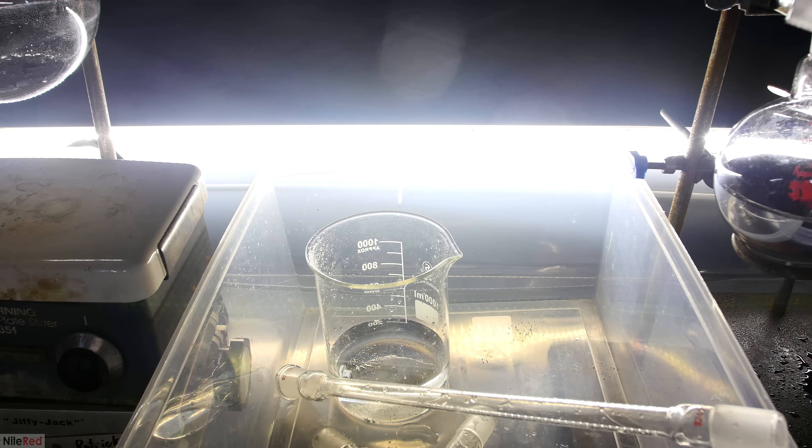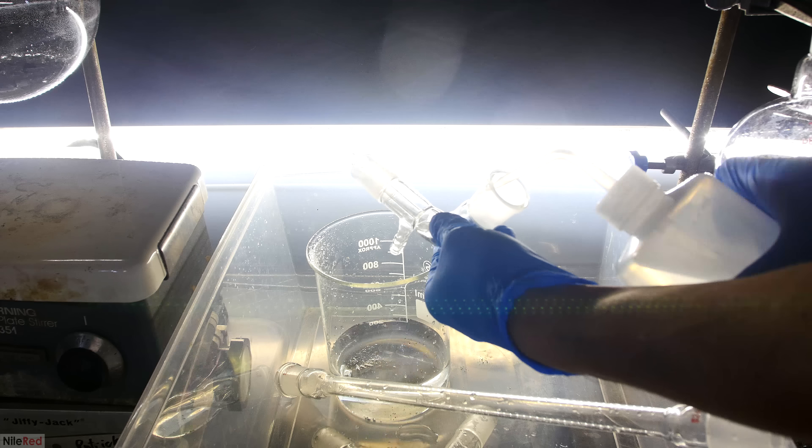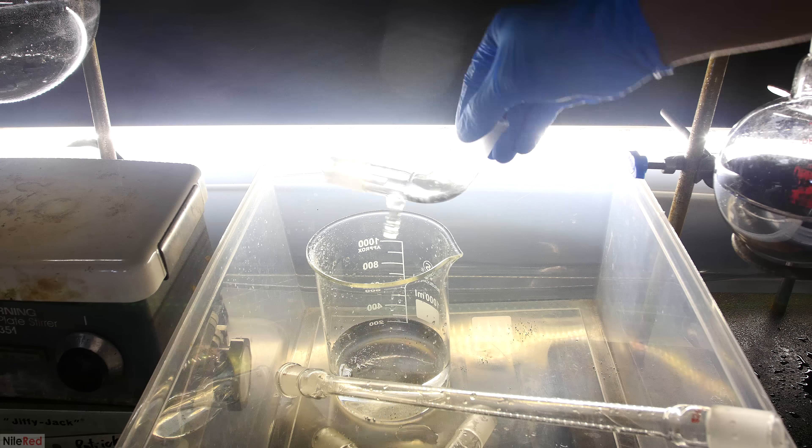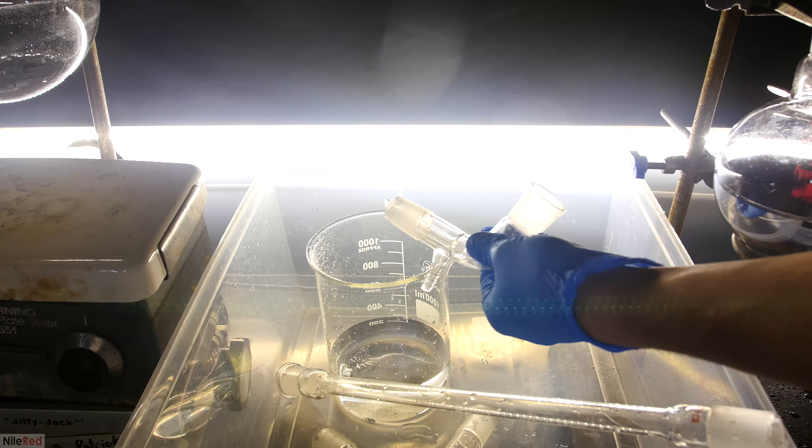Now I get to the vacuum adapter, which is the last major piece to wash. When the vacuum adapter is removed, it's really important to cap the receiving flask, just to prevent any dust or dirt from falling into our fresh mercury.